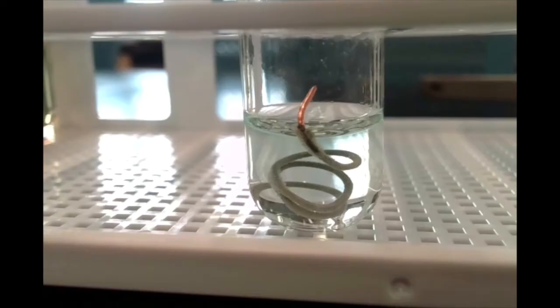Okay. Now, if you let this reaction go for a while, you'll notice the solution start to turn blue. I think you might be starting to see some tinges of it right now. It is probably looking a little bit bluer. All right, that blue color you're seeing is actually copper 2 nitrate. So it's the copper 2 plus ions that are being formed from the copper metal that give the solution that blue color. Okay.